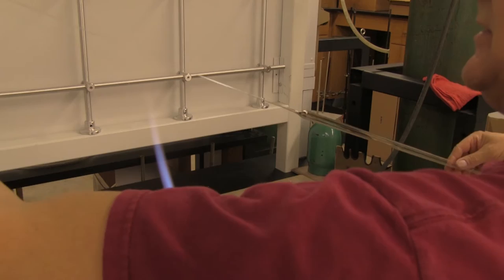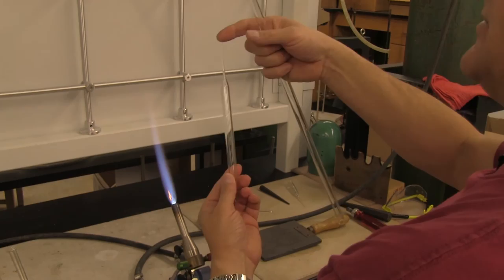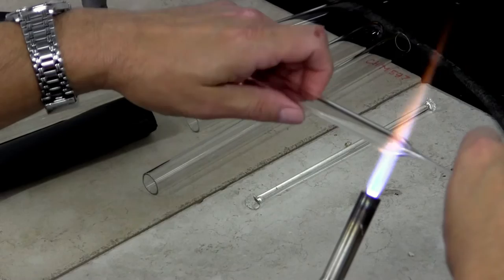Just wait a little bit. This now becomes our handle. Since it's thin glass, we can hold it.